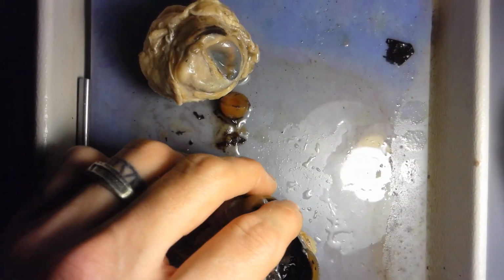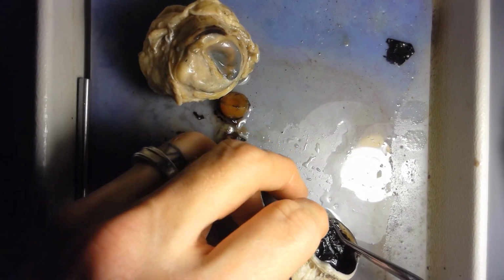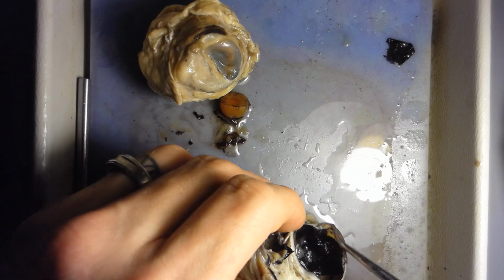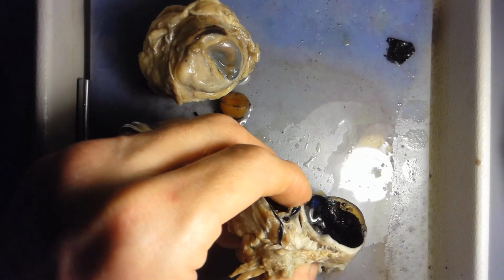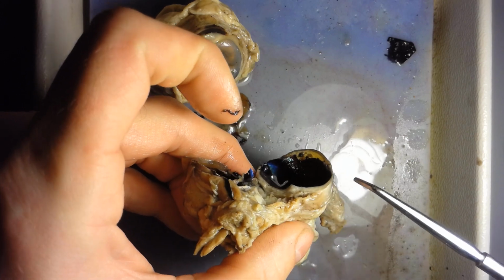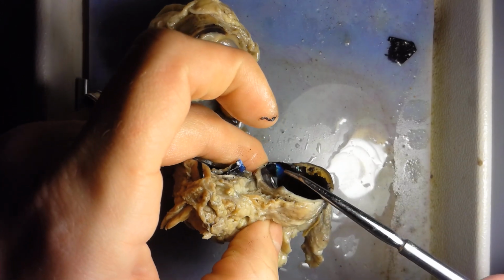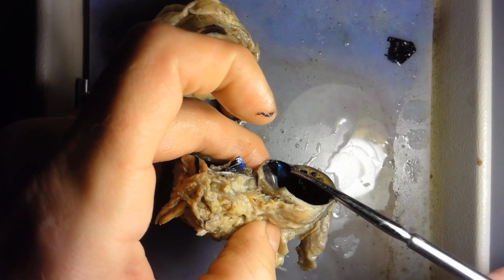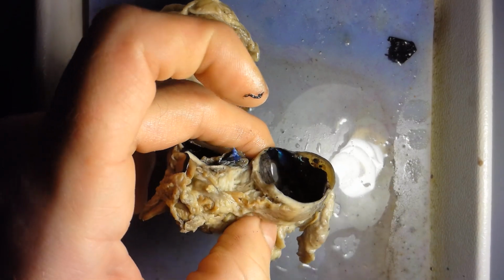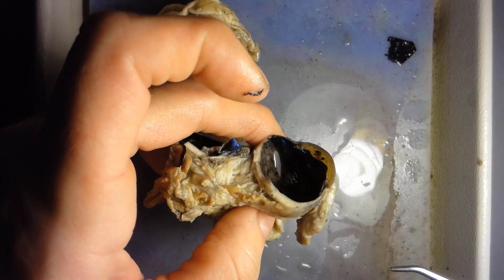But on the real eye here, especially since we're dealing with a sheep eye, the choroid coat actually has a bit of a bluish iridescent look to it. If I angle the eyeball in a way that it's reflecting some light, you see this bluish-green reflective nature right there. That's why, when you look at the lab list, it says tapetum lucidum.